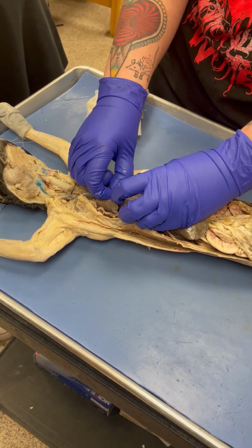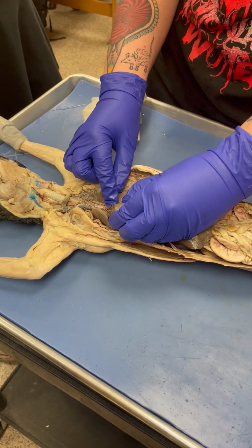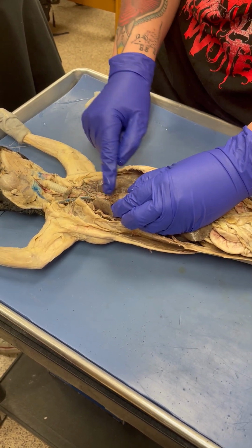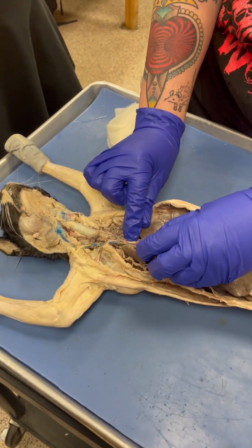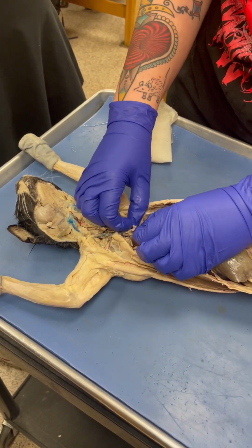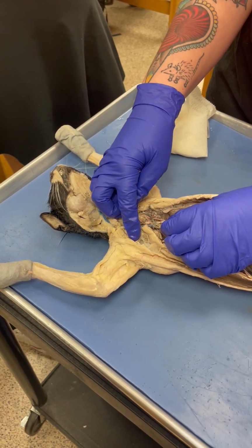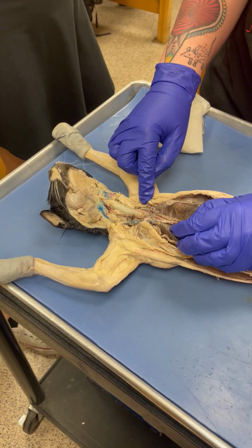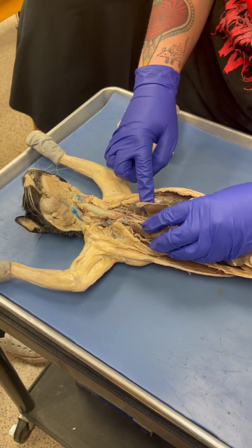Coming out of the left ventricle, you have the aortic arch, so that's that right there. This first branch off the aortic arch is the brachiocephalic artery. There's only one brachiocephalic, and it's just that short little portion there. It splits into 3 here, so you've got your carotid on either side, and then you've got your right subclavian. The second branch off the aortic arch, that's the left subclavian. So the subclavian is with the carotids, and this one is separate.